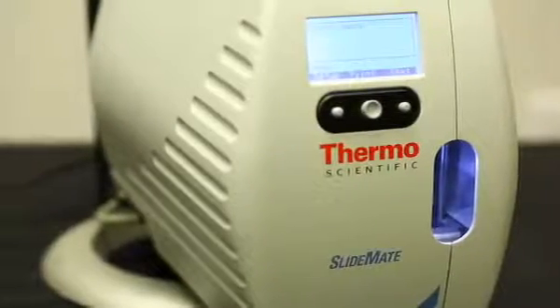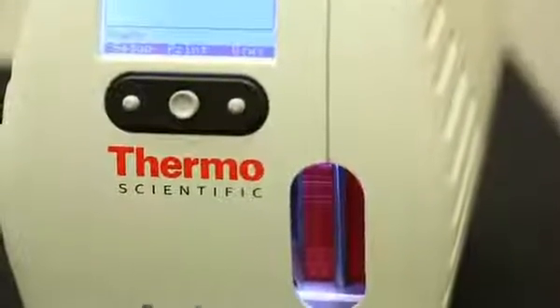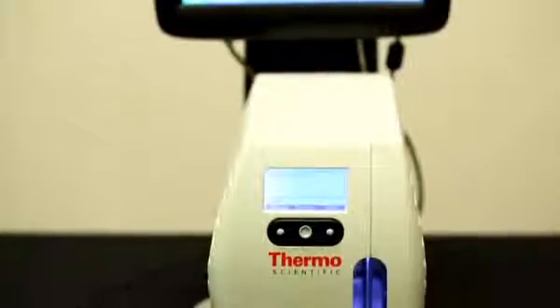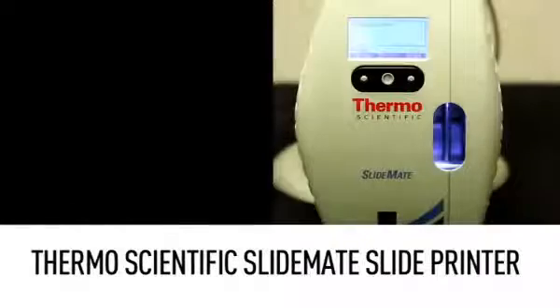The presentation that follows is intended to guide those that use and service the Thermo Scientific SlideMate slide printer. We will demonstrate techniques and practices that will help assure trouble-free operation and improved performance of the instrument.